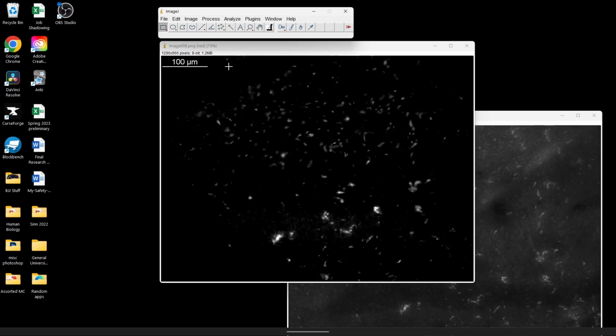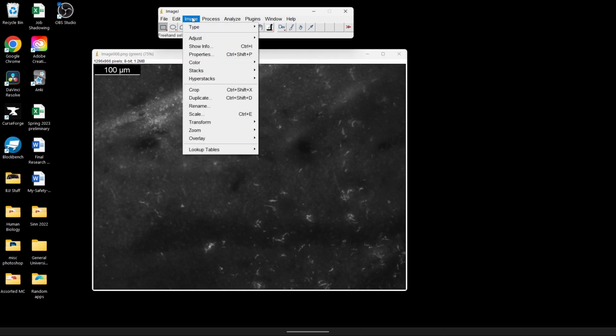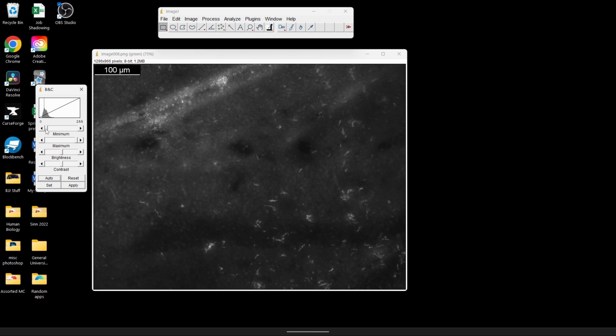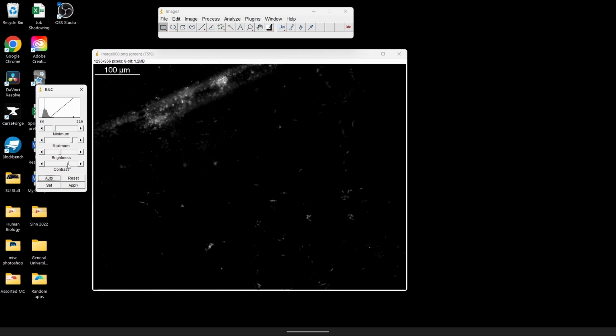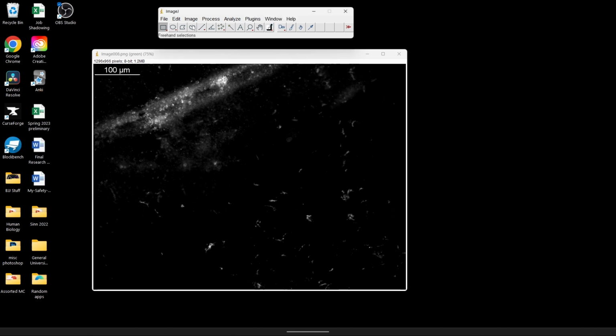Now, this is the last one. This is our green channel. Not a great stain. We've got a lot of background, and the values that are really well stained aren't really that bright. Here we're going to have to mess around a little bit. We might have to up the brightness and contrast a lot more than we did our other images. We'd really like the maximum values of each channel to kind of match, which means that we're going to have to probably tone down DAPI like we did before, but some of these weak stains we've got to really tone them up. So now we finally got rid of all that kind of non-specific background gray color. So we're going to hit apply, fully apply it, and now we're ready to see what it looks like all together.